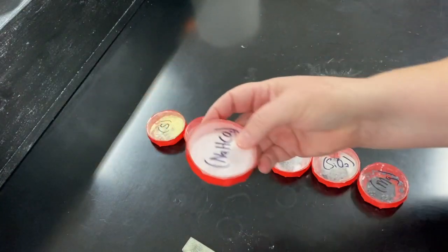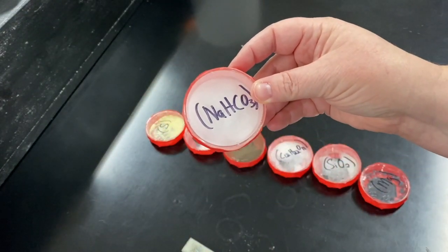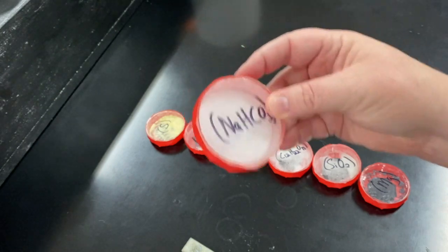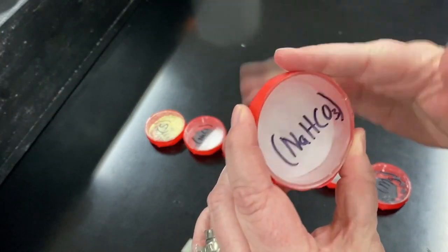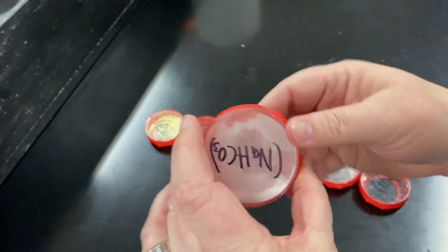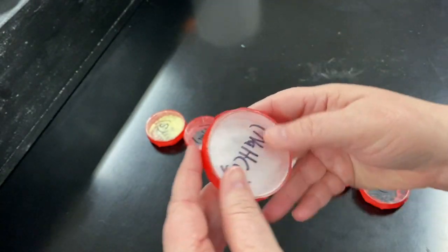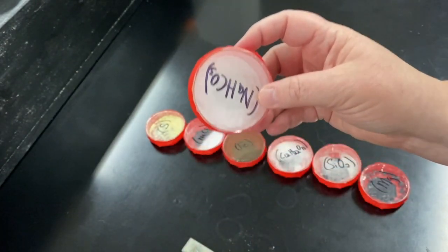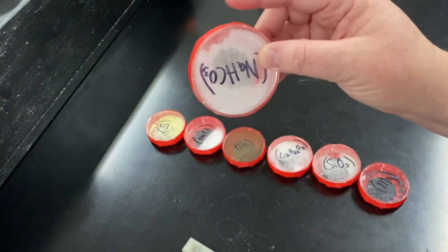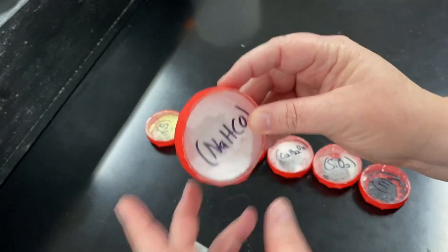And then this is sodium bicarbonate, also known as baking soda. It is also solid — kind of powdery in nature. It's stuck to the sides of the petri dish there for a second. So very powdery, kind of a nice dull white color.